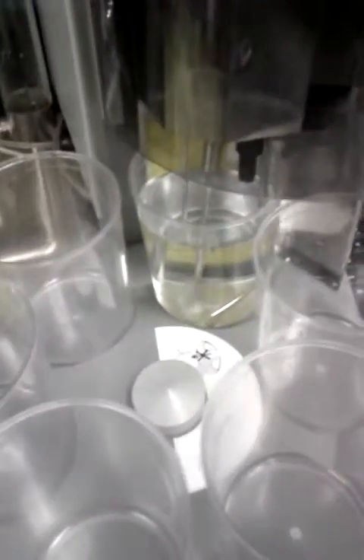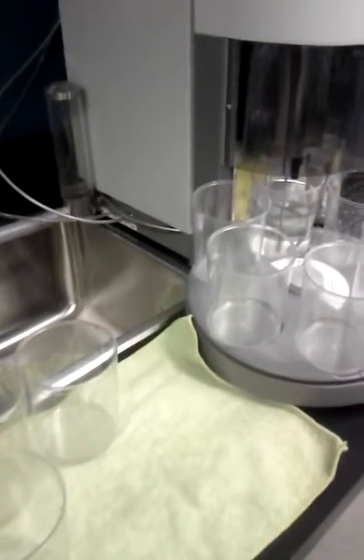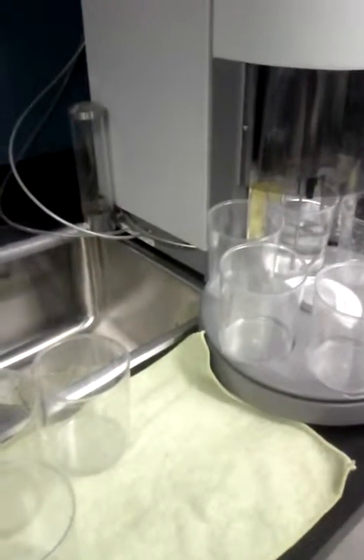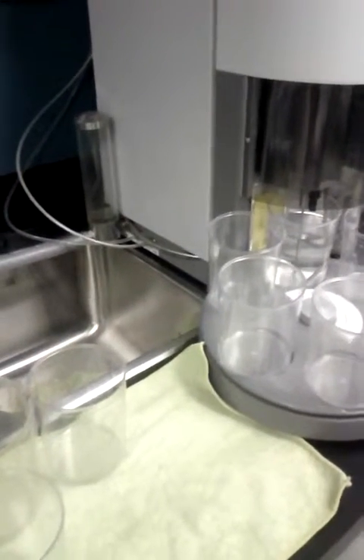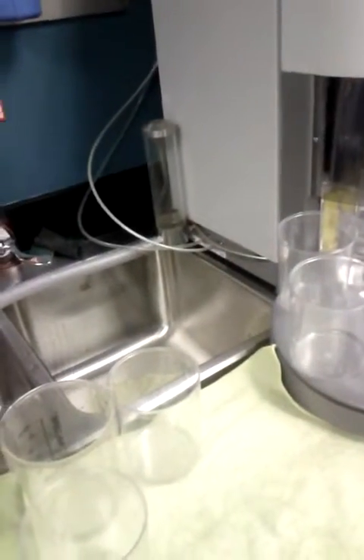I don't know if I put some of them in the mixture, it's going to separate like what you did to your samples. Yes, you can do that, and you can use the power one, the first. It's low, just meant to separate. I think so.